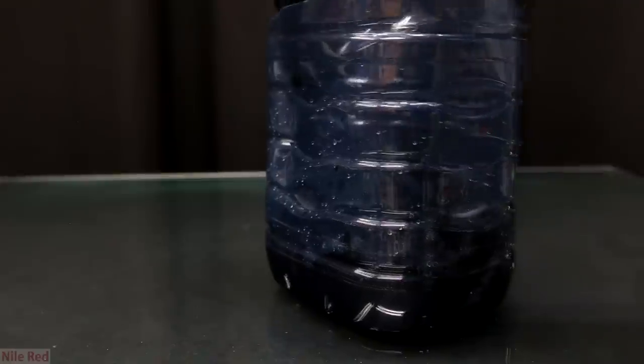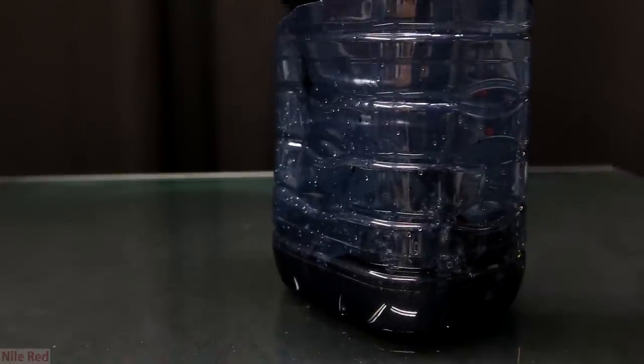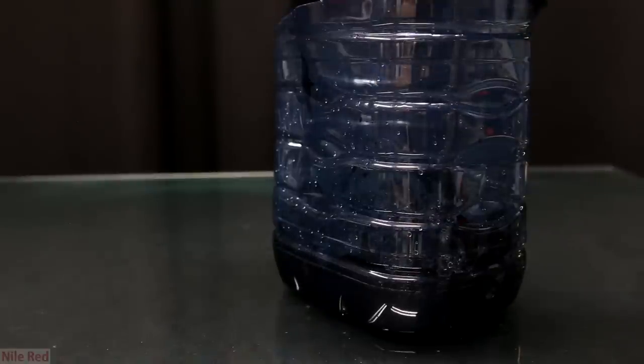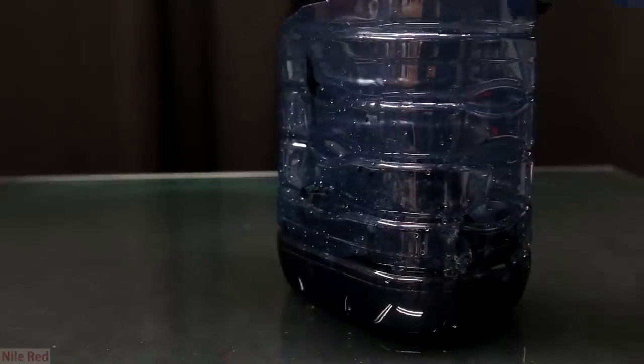It might be a little hard to see in this shot but at the bottom there was still a lot of thick manganese dioxide. To do a proper washing we're going to have to have a lot more water. I washed the beaker a few times with water to get out as much manganese dioxide as possible and then I put the beaker aside.